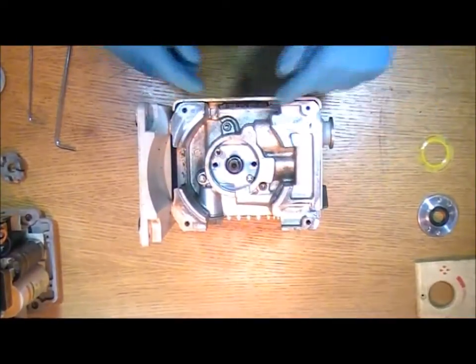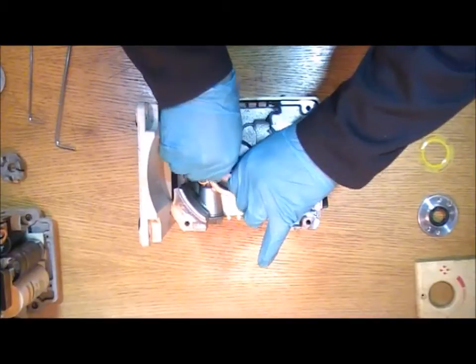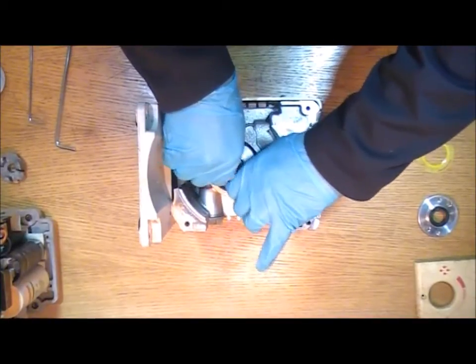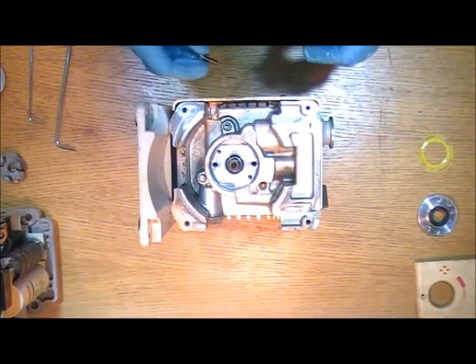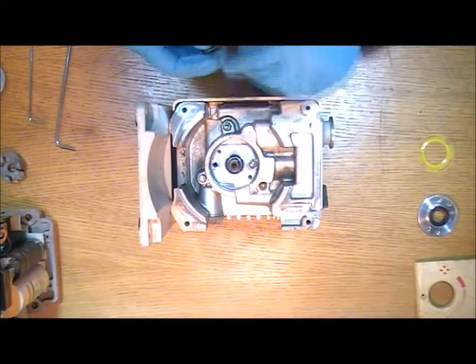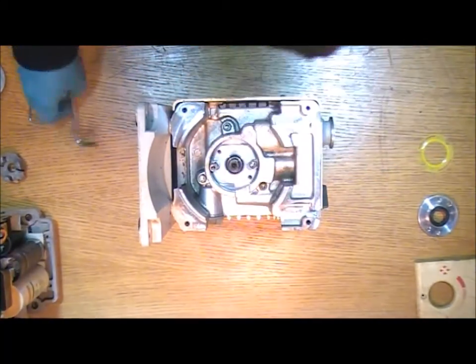And as it goes down just check it visually around the seal to make sure it hasn't caught. If it does there's no problem. Just lift it out carefully and press it down again. And put the bolts into the correct positions.